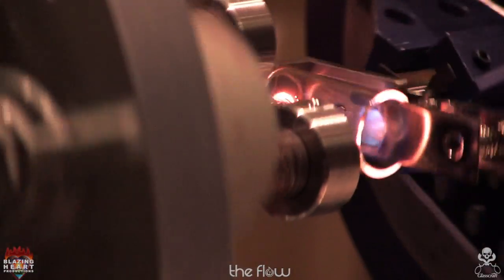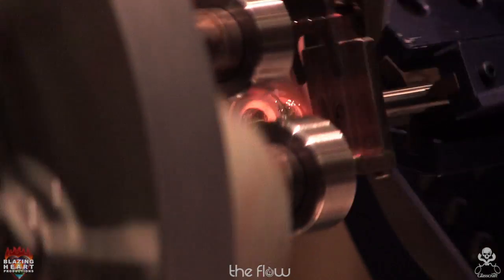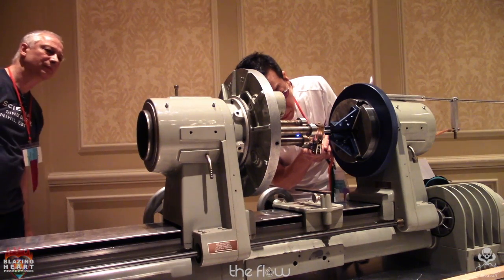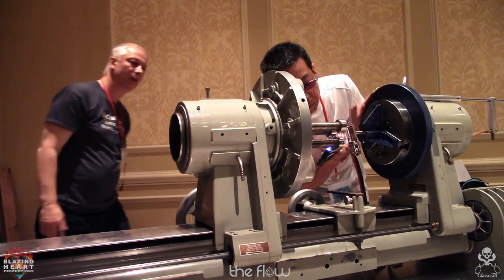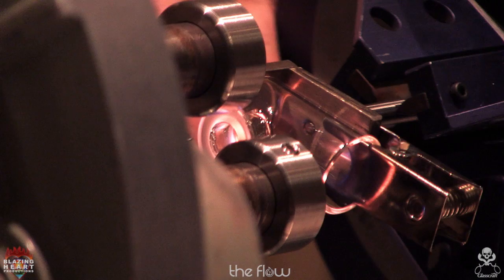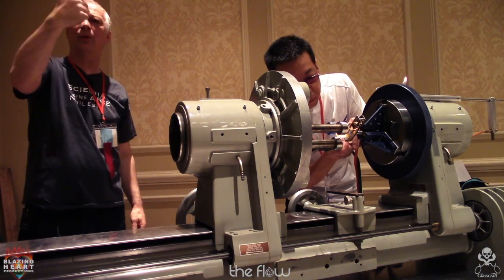There's just a little splash on the sidearm. As the shoulder starts to collapse, he's bringing the sidearm in to tag the shoulder as it's coming down. So now he's starting to heat the sharp edge of the seal out. He doesn't want the sidearm to collapse, so he's working it out about 25% of the way around each time.